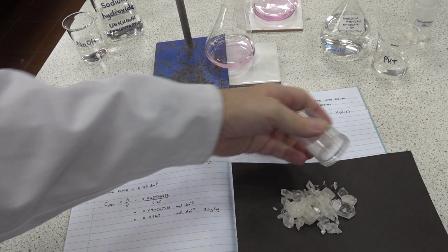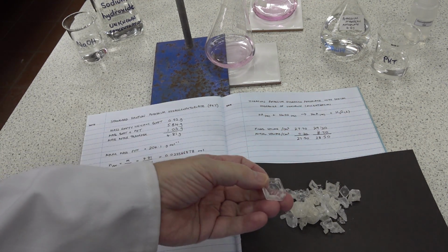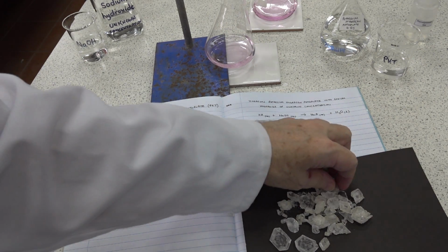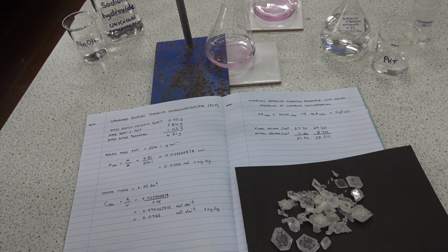These are crystals from just one group, and potassium hydrogen phthalate there. Rather nice crystalline shape, but we don't really want to be flushing that down our sinks with the dirty waste sink there. So we've replaced potassium hydrogen phthalate with alternatives now in titrations at this level.